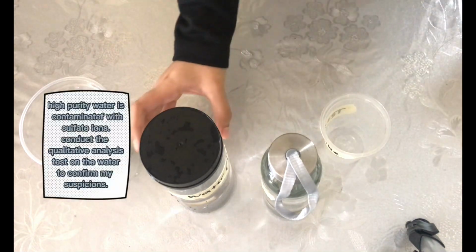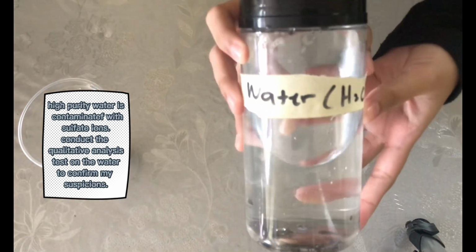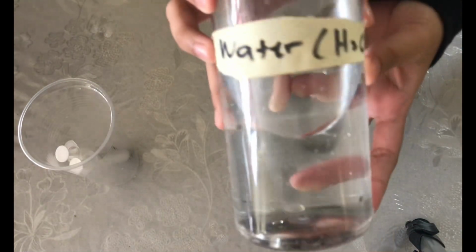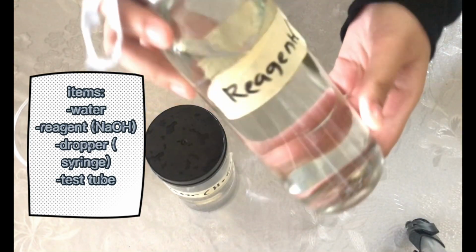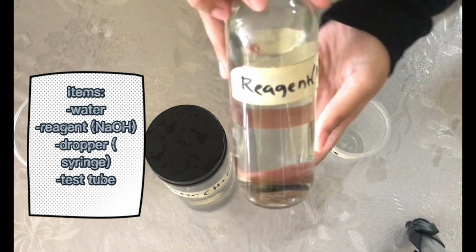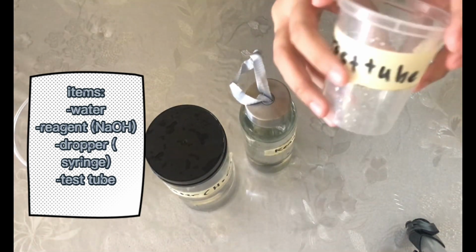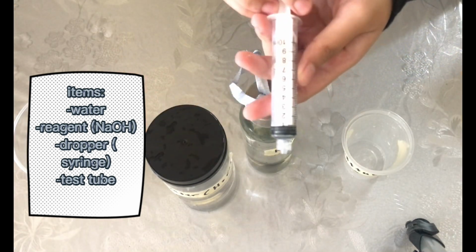A sample of high purity water is contaminated with sulfate ion. So I'm going to conduct the qualitative analysis test on the water to confirm my suspicions. The items that I'm going to need are water, reagent, NaOH, sodium hydroxide, and a test tube, also a dropper.